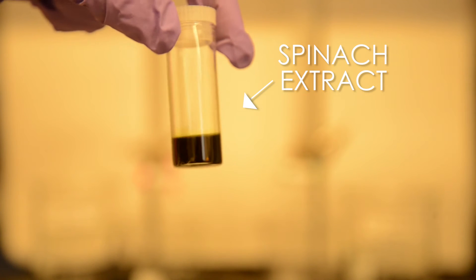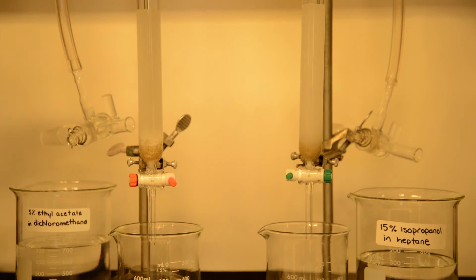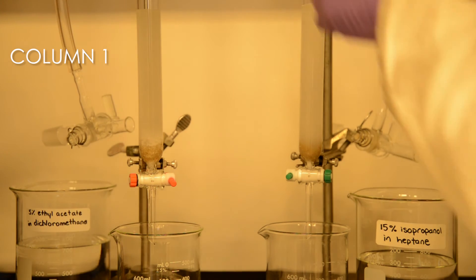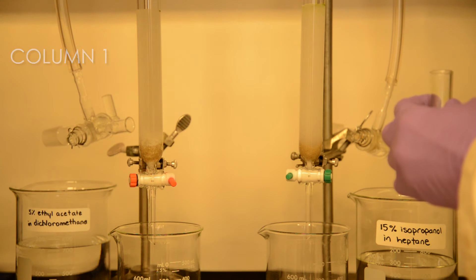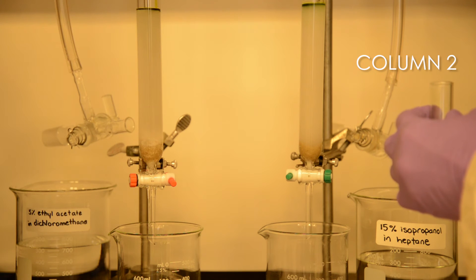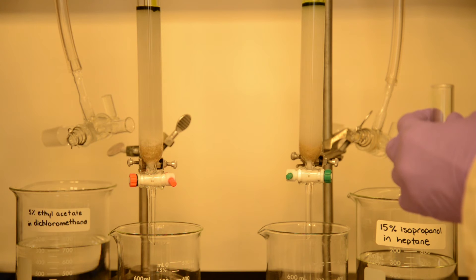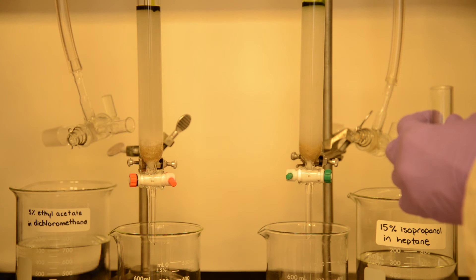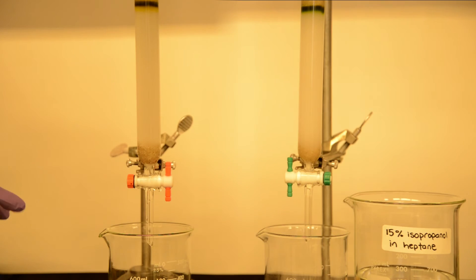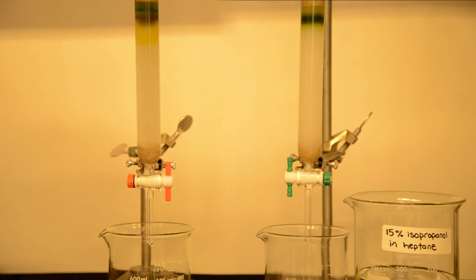Let's head into the lab to show you just how well one of these greener alternatives works. For this experiment we will be isolating one of the many colorful compounds in a spinach extract. We have two columns already prepared here. In column one we are going to separate the mixture using DCM with 5% ethyl acetate as our solvent, and in column two we will use the greener solvent of choice: 15% isopropanol in heptane. After putting our solvents and spinach extract into the top of each column we let the liquids flow through, which causes the chlorophyll compounds in the spinach to separate. We'll speed up the footage so you can quickly see what happens.